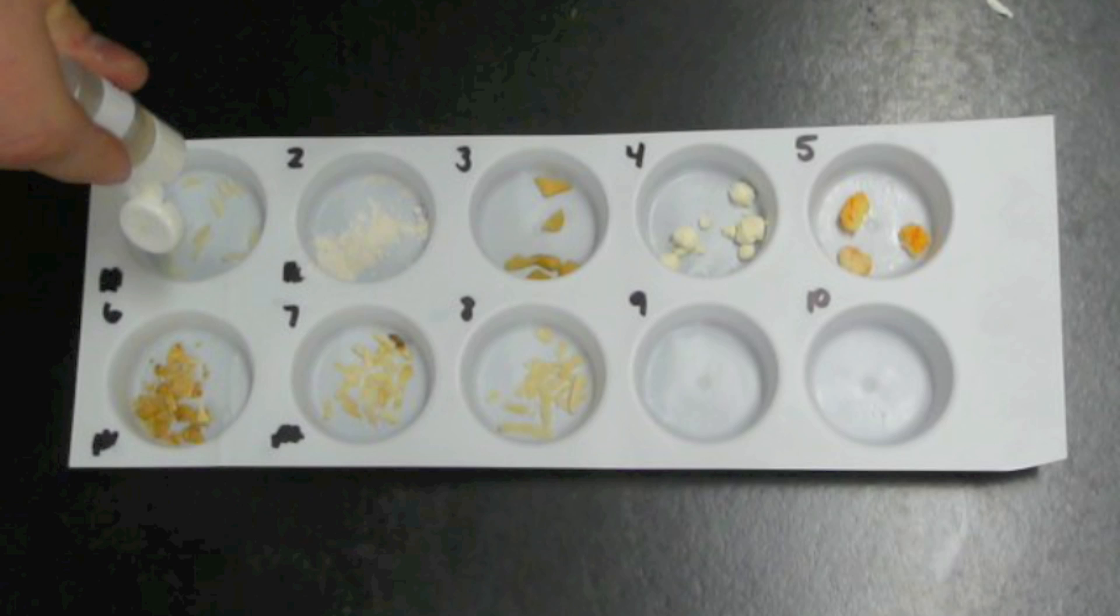The first thing we're going to do is mix water with each of our foods. If there's glucose in any of these foods, it will be pulled out into the water and food mixture.